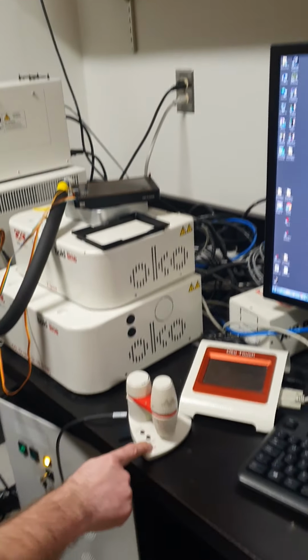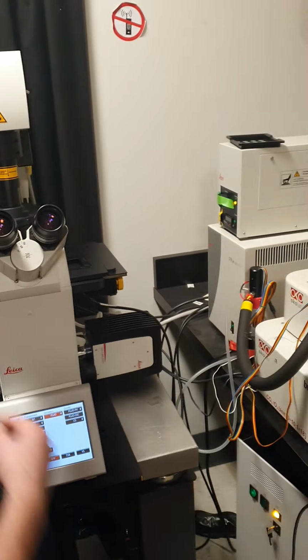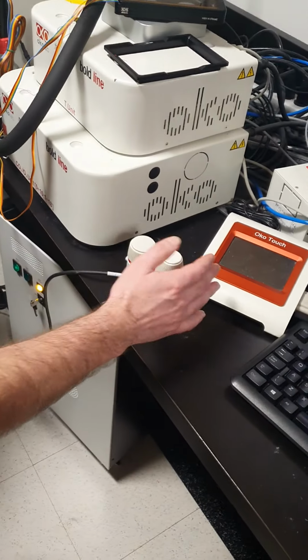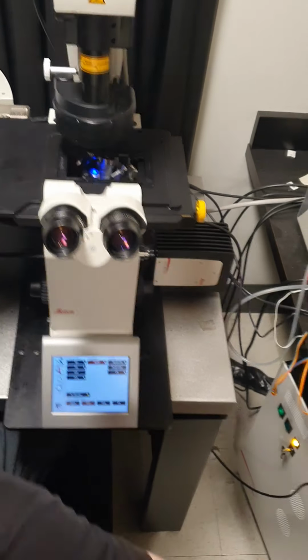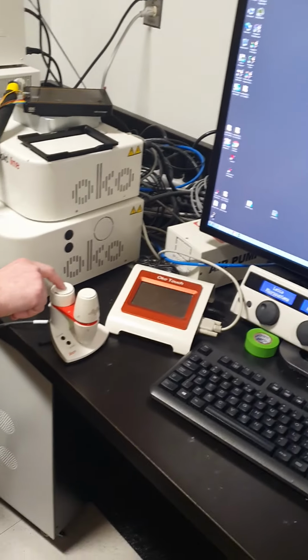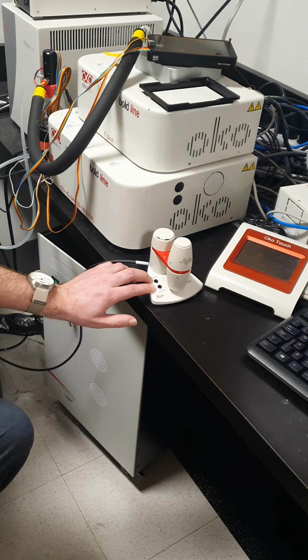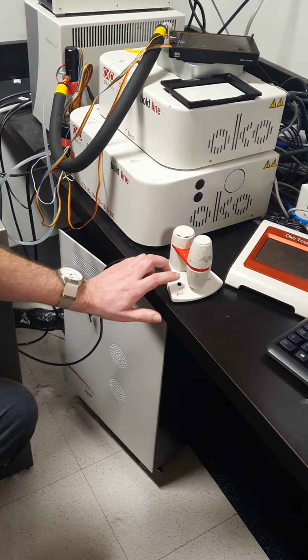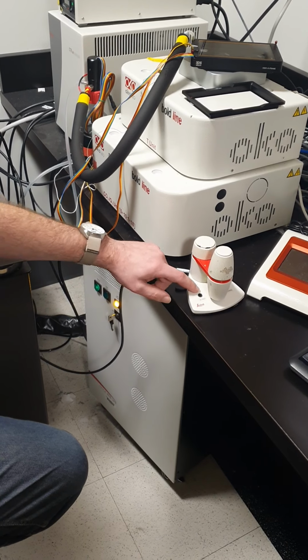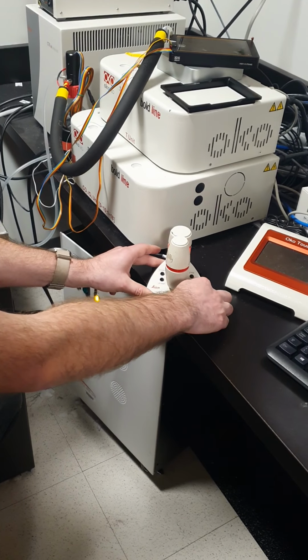Oh, and then this guy here, this is our stage controller. So you can see here we're sort of off the sample. So these knobs in the front are our X and Y controls. So now we can position our sample centered over the objective. And then in back, this is our Z control. And the buttons on the side are to switch between coarse adjustment and fine adjustment of the stage. So you can put on X, Y fast, to quickly move to our sample. And then when we want to make smaller movements, click precise, and then it will move much more slowly. And same on the other side, coarse, fine, Z adjustment.